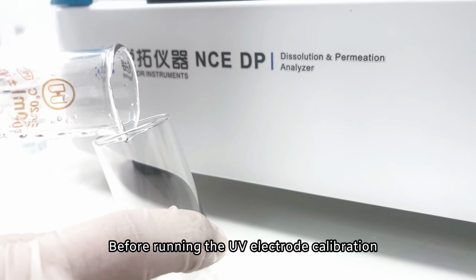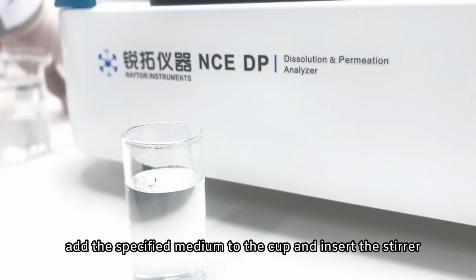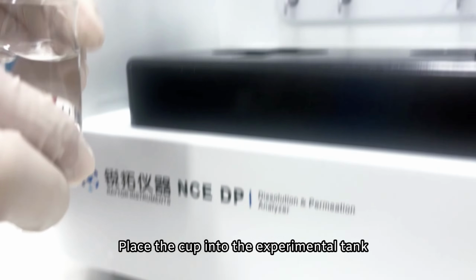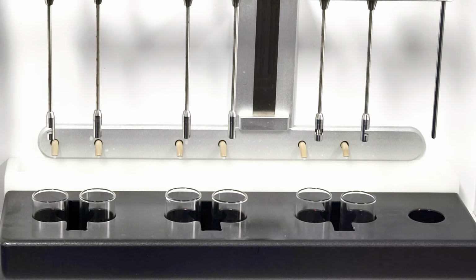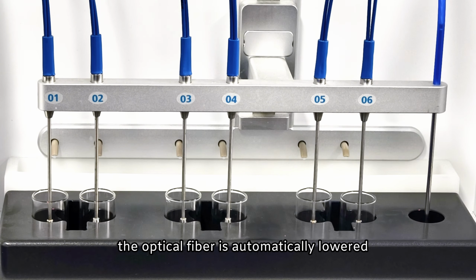Before running the UV electrode calibration, add the specified medium to the cup and insert the stirrer. Place the cup into the experimental tank. After the calibration is run, the optical fiber is automatically lowered.